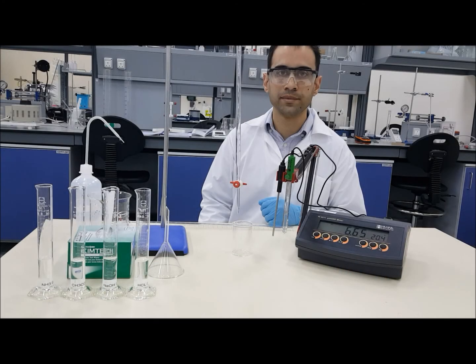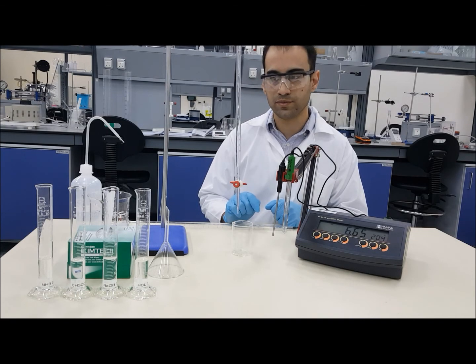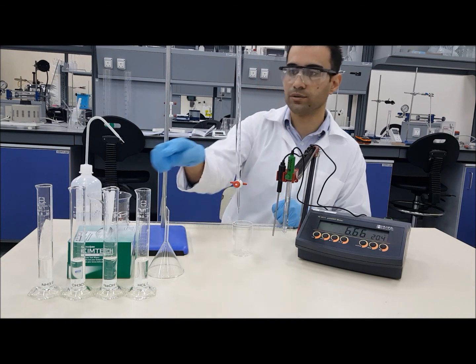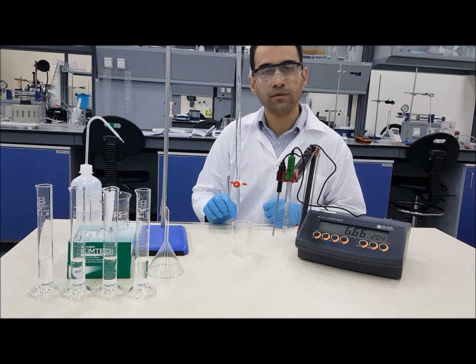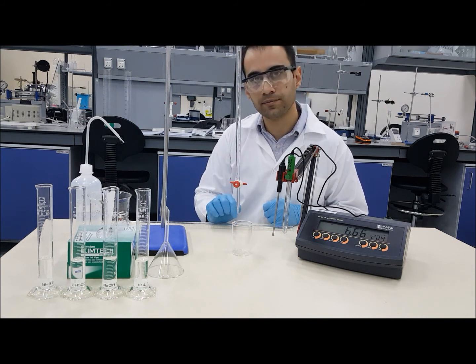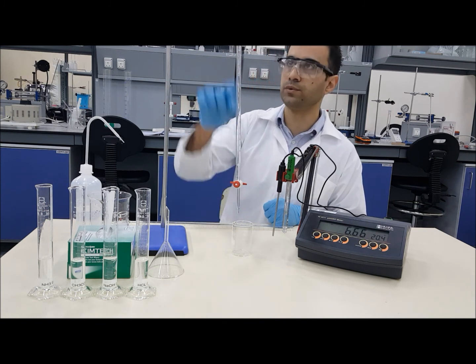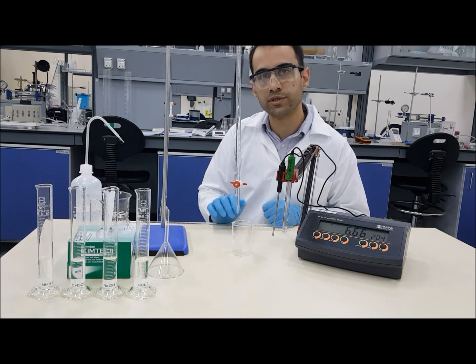Hello and welcome. This video will cover acids and bases concentration by titration method. In this experiment we are going to do 4 trials, each trial with 2 different chemicals, 1 acid and 1 base. Always we are going to add acid to this main beaker, and we are going to use the burette available here to add small portions of the base.